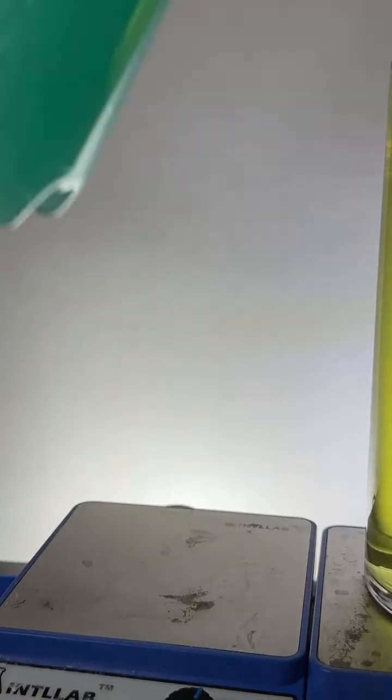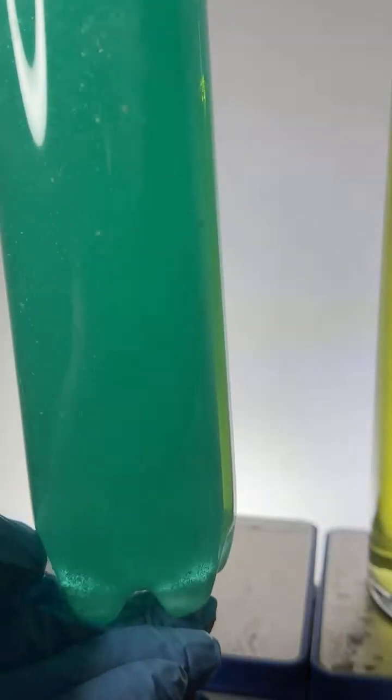Here we go. I am mixing this up. Mixing it up.